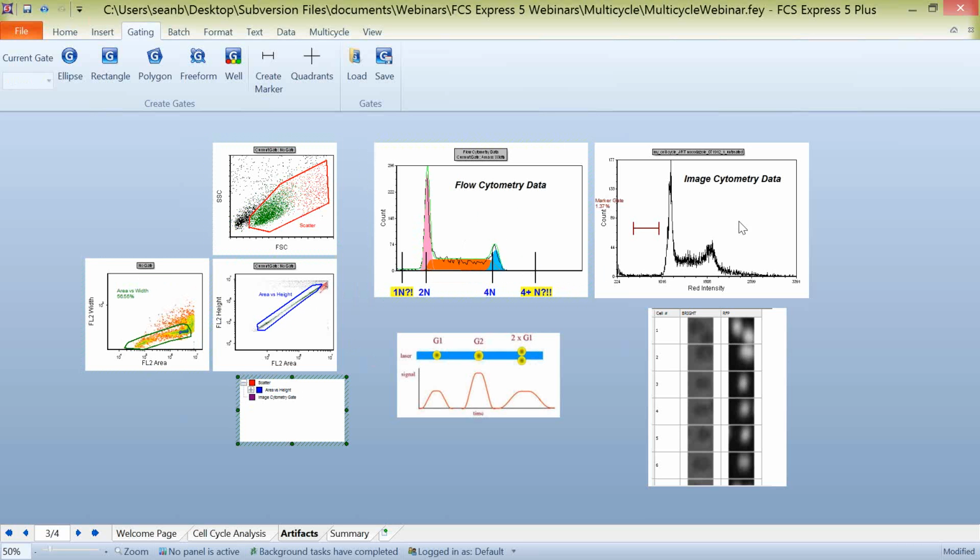Now, with image cytometry, we have some image cytometry data here on the right, and we have the individual cells associated with all the bins in this histogram in what we call a data grid. You can have some other artifacts occurring, and they're actually very similar artifacts. In segmentation routines, which define where a cell is in your analysis, segmentation routines can mark 2 cells as one. They can cut off a piece of a cell. Cells can be overexposed by your microscope.